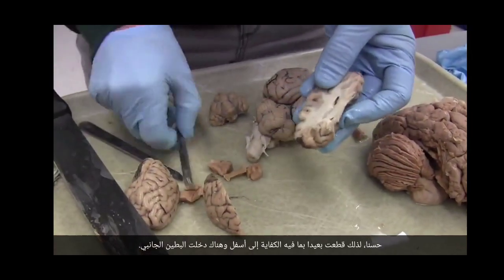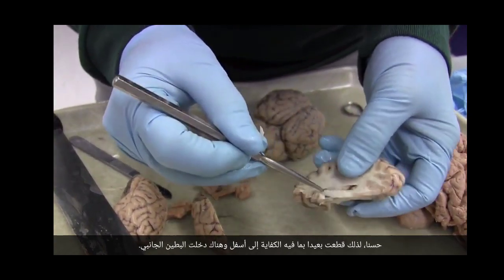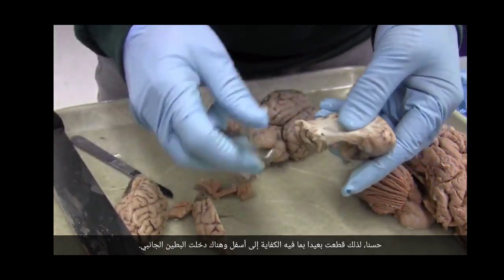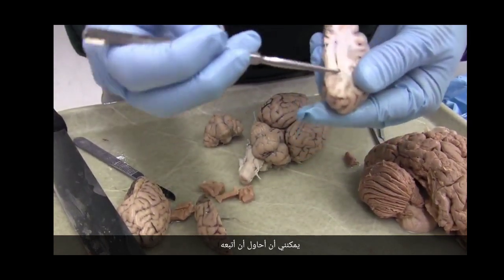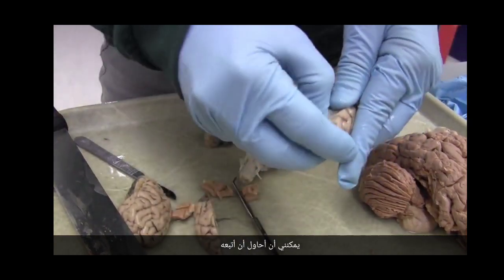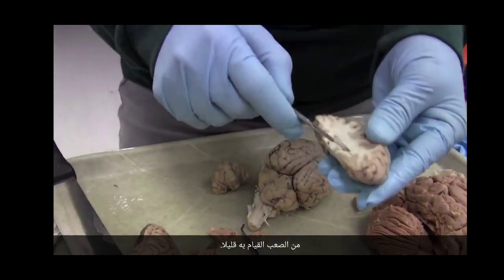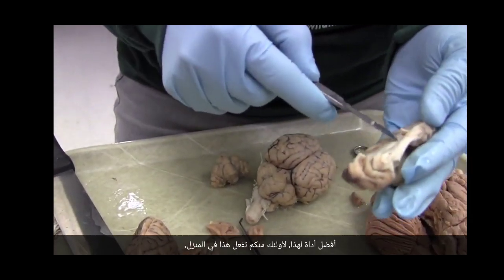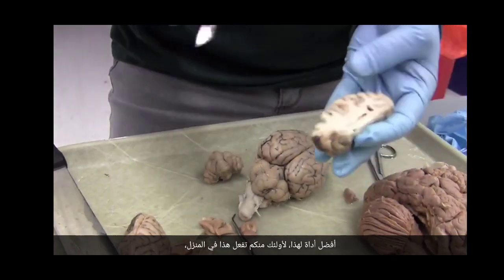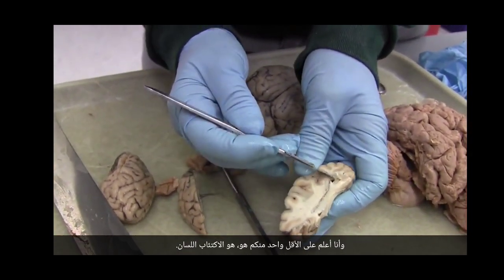Okay, so I cut far enough down, and there I've entered the lateral ventricle. I can kind of try and follow it. A little hard to do. The best tool for this, for those of you doing this at home, and I know at least one of you is, is a tongue depressor.